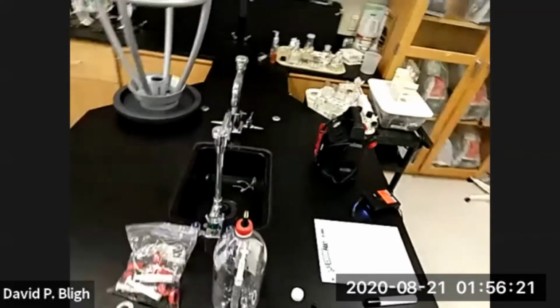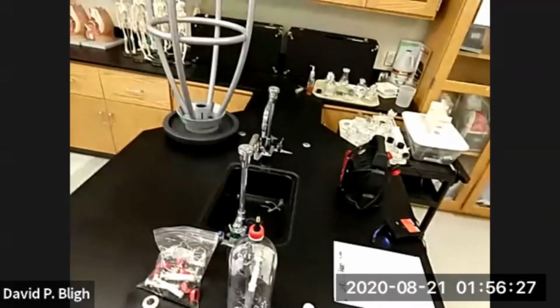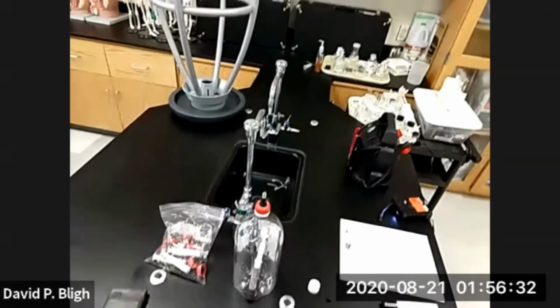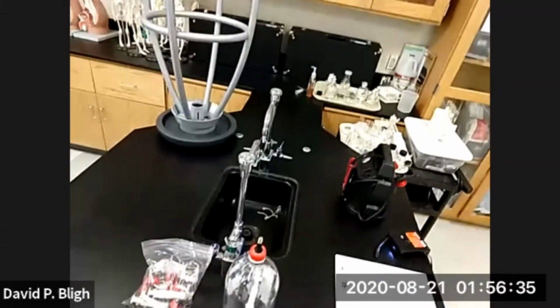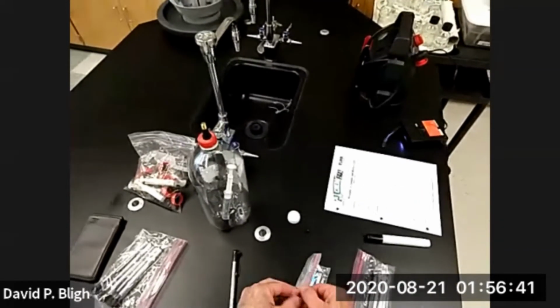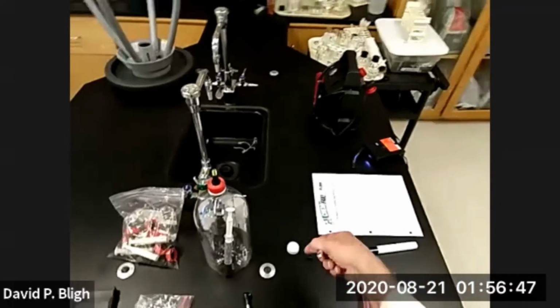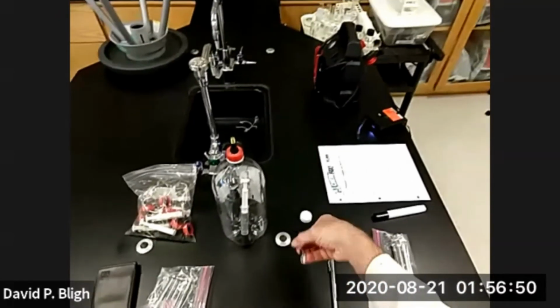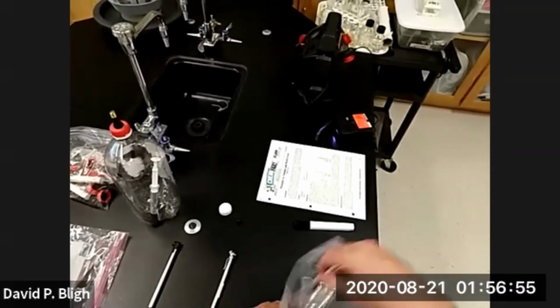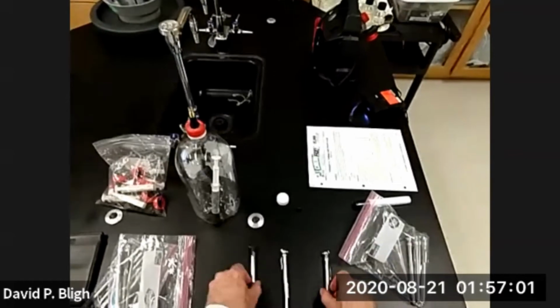So how do we know what the pressure is on the inside? Well, we use a tire gauge, which means when we read the tire gauge, the values that we obtain from the reading are in terms of pounds per square inch, PSI. And we need 3 of them for different ranges. They don't make one tire gauge that'll do the entire experiment for us. This one's a medium, this one's a low, and this one should be a high. Yeah, I got them marked on the ends here. All right.